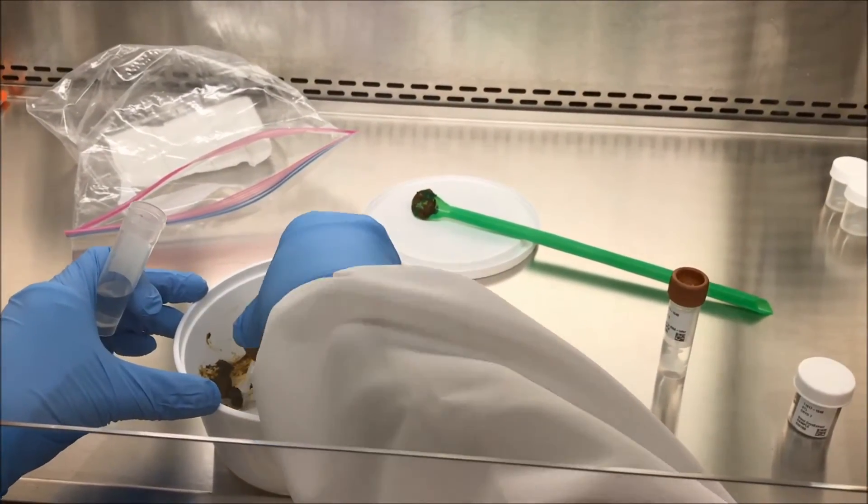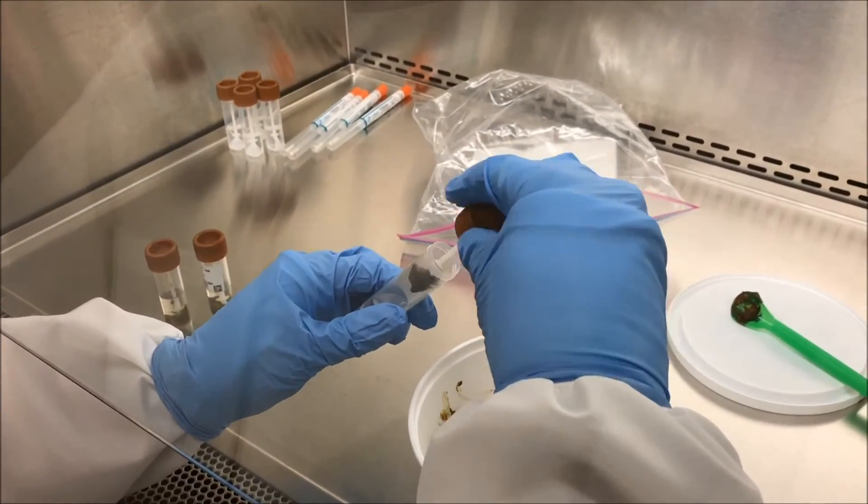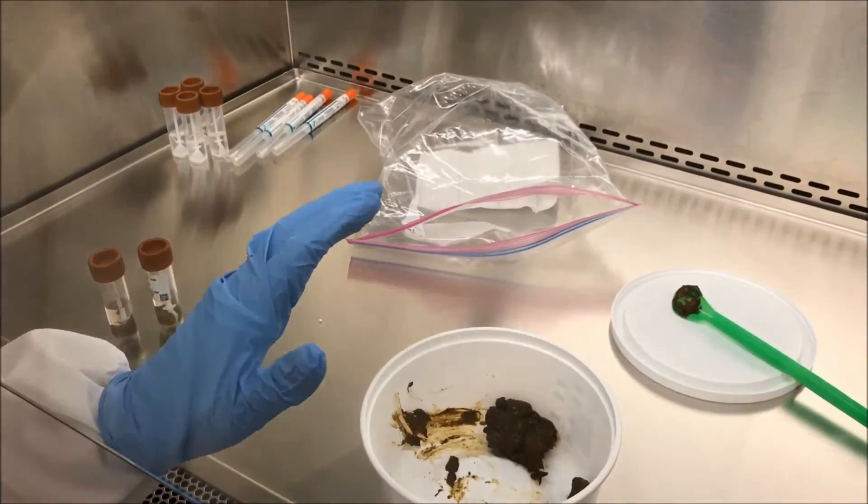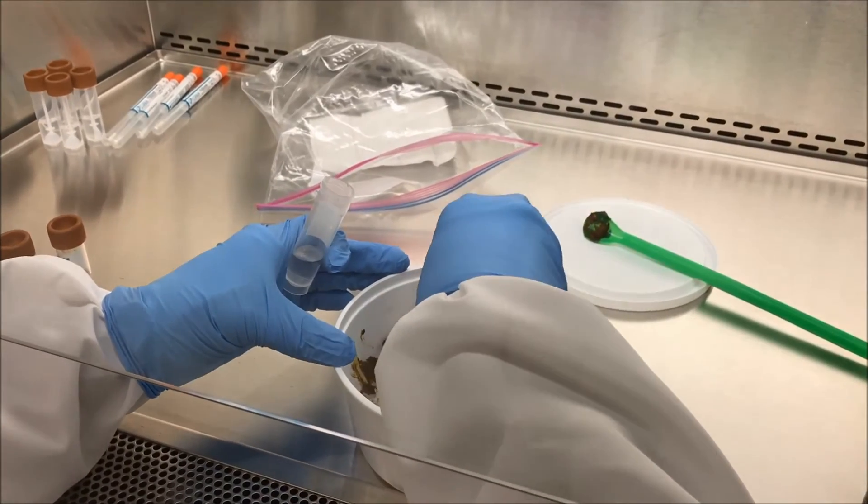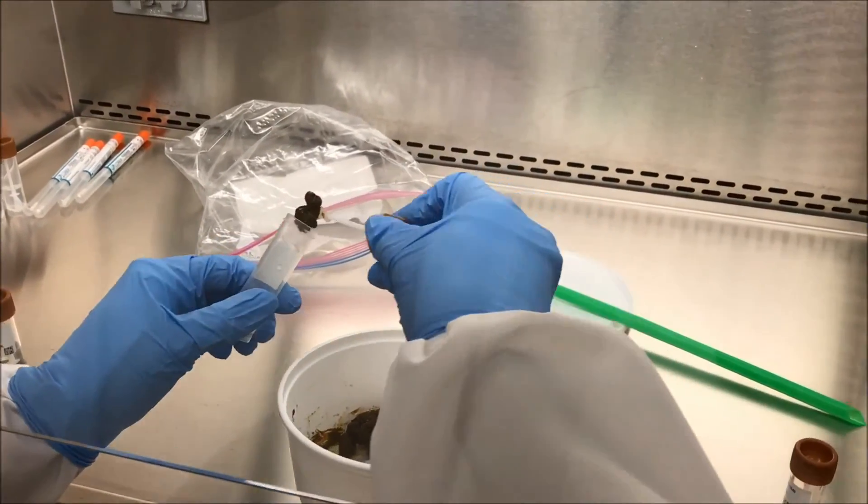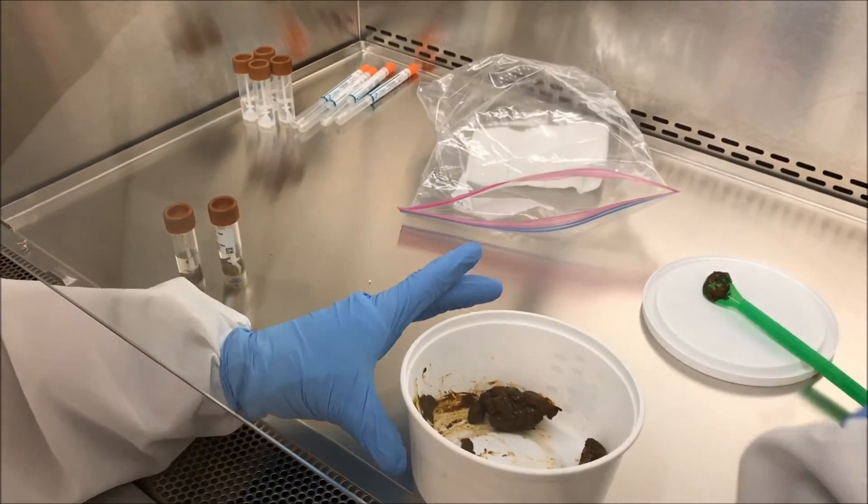See, this looks a little trickier. But filling up just the top of the spoon top is probably your best bet. Okay. Just like that.